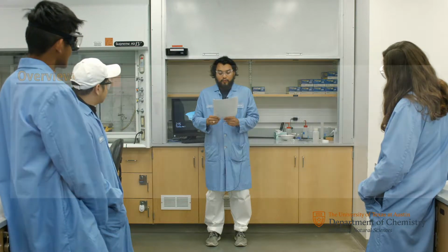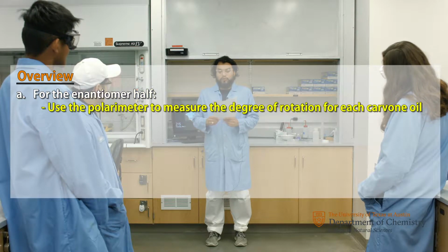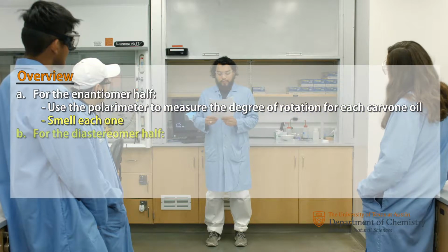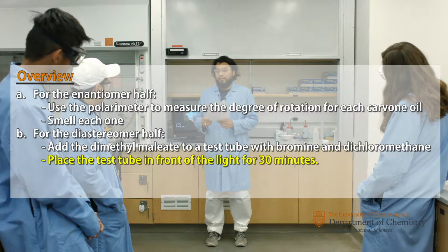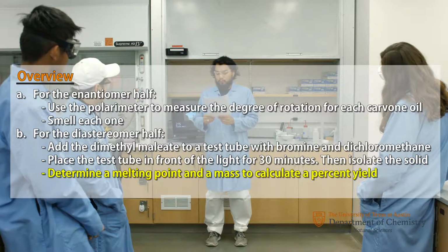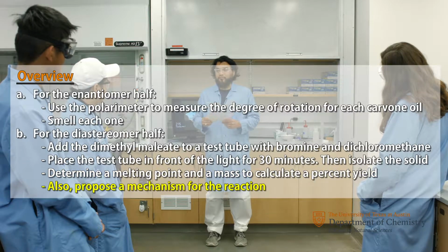The overview of the experiment is as follows. For the enantiomer half, use a polarimeter to measure the degree of rotation for each carvone oil and also smell each one. For the diastereomer half, add the dimethyl maleate to a test tube with bromine and dichloromethane. Place the test tube in front of the light for 30 minutes and then isolate the solid. Determine the melting point and mass to calculate a % yield. Also propose a mechanism for the reaction.